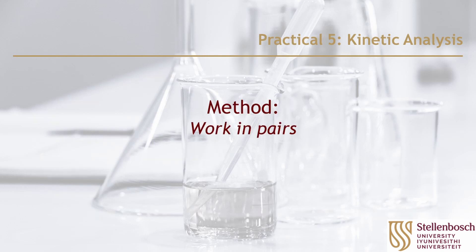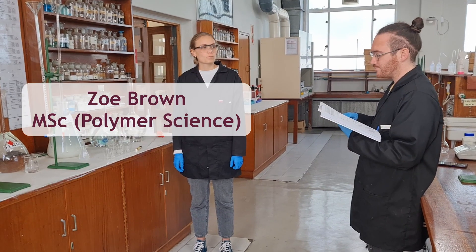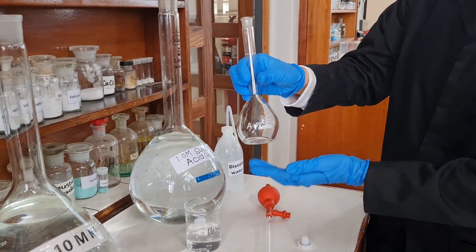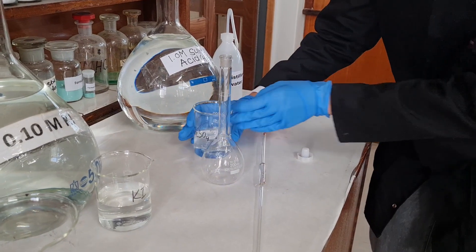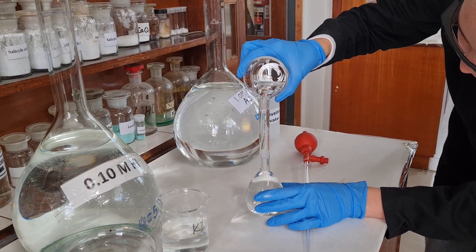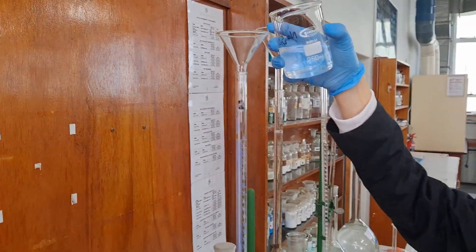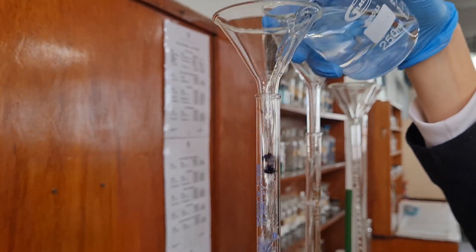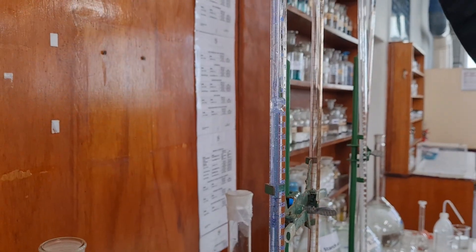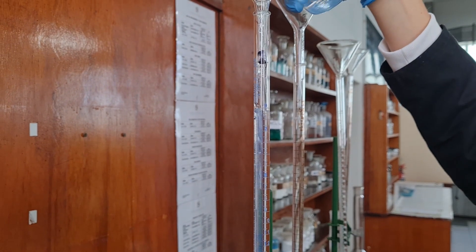During this practical, you must work in pairs. First, collect a pipette filler. Then collect H₂SO₄ in a 200 milliliter volumetric flask. Collect your Na₂S₂O₃, potassium iodide, deionized water, and hydrogen peroxide straight into the four burettes. Be careful not to overfill the burettes or to spill the reagents. First, rinse each burette out with the solution that it is to contain. Then fill the burettes, set them up on the retort stands, and mark them clearly.